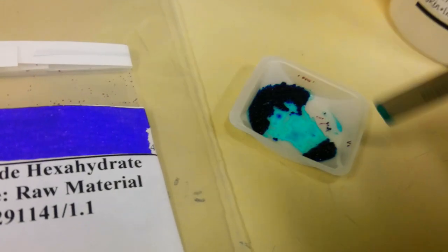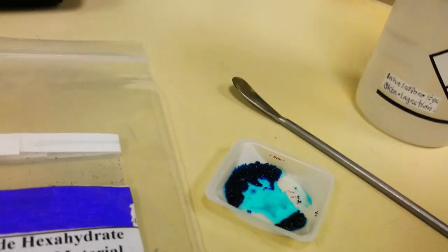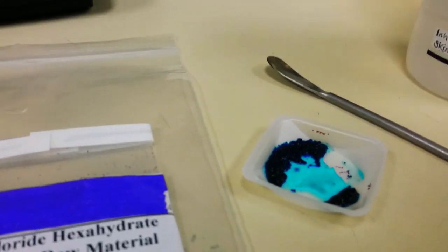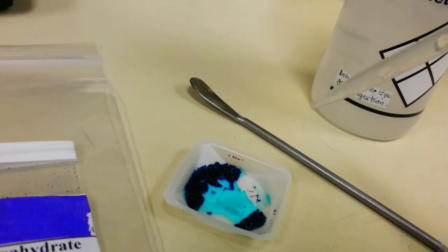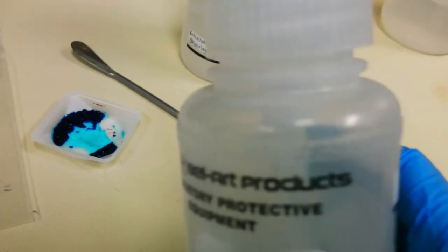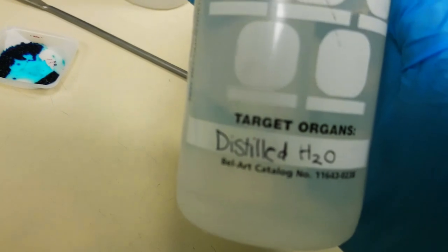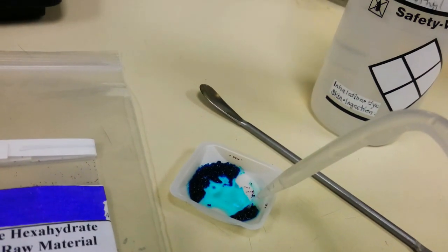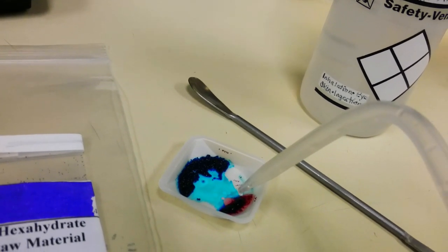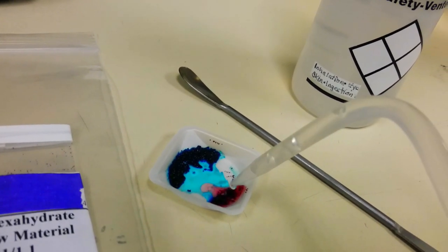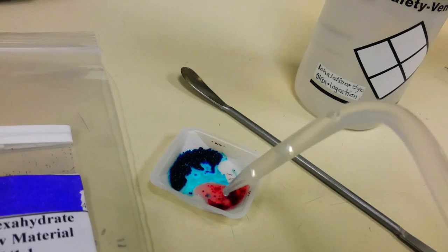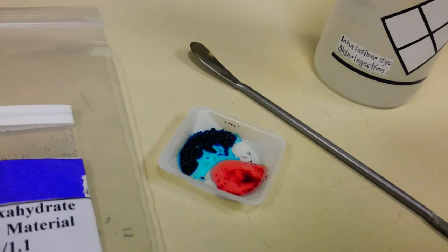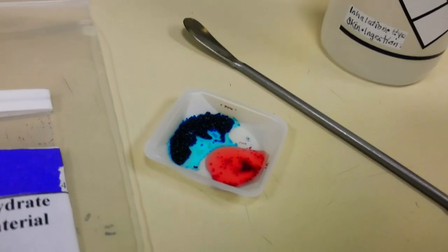Another cool part is that when I add distilled water, it goes back to being pink, which I think is very cool.